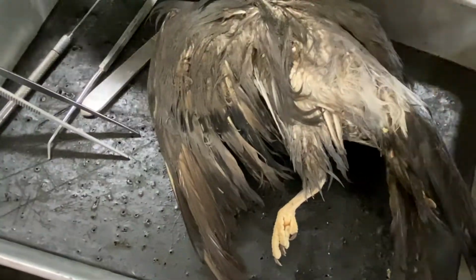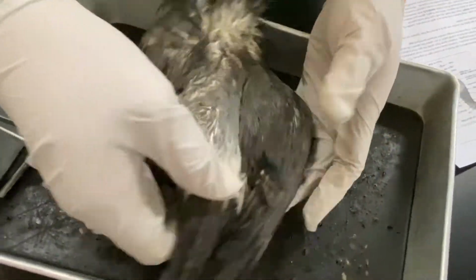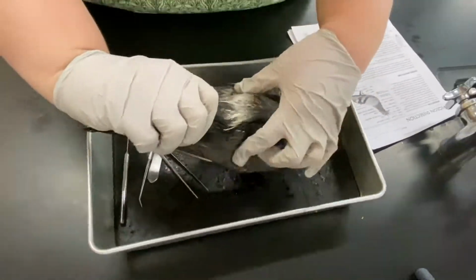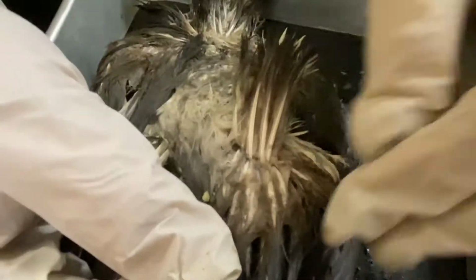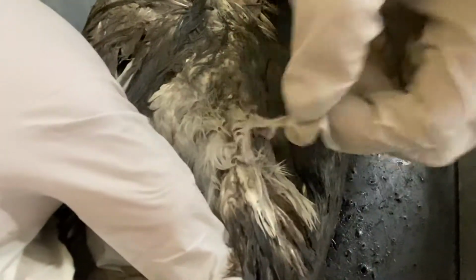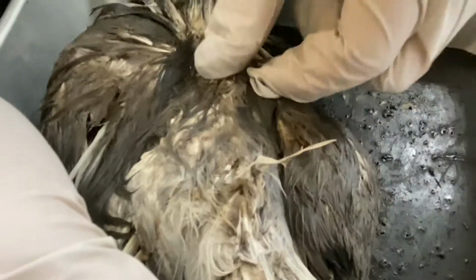Now, when they preen, the birds are going to take advantage. I'm on the dorsal side. This bird is a little bit twisted, but if I look, and it takes a little bit of digging, I pick up some contour feathers, and then these ones underneath here, these are downy feathers. The contour feathers are the ones that give them their coloration and things.